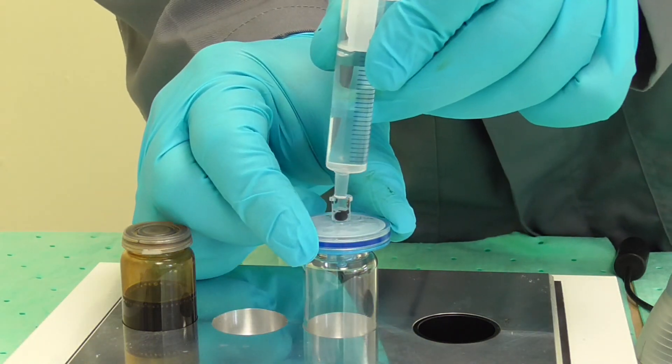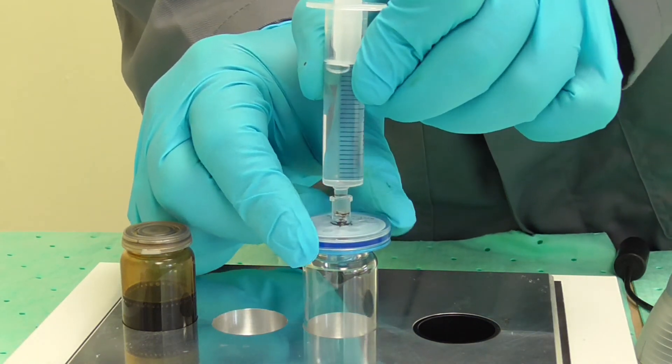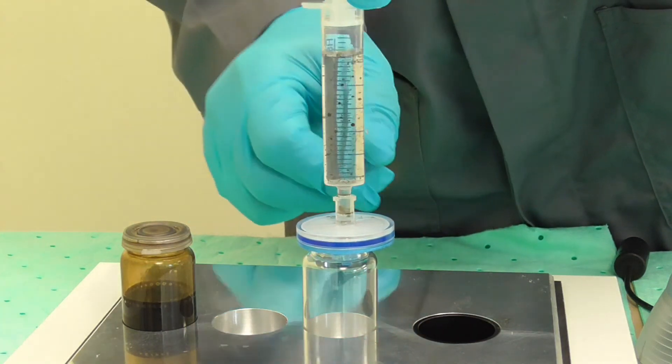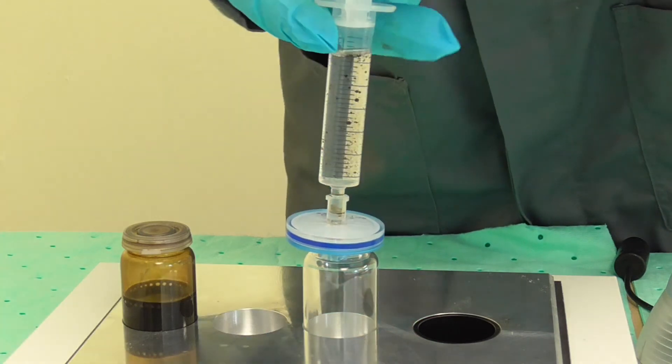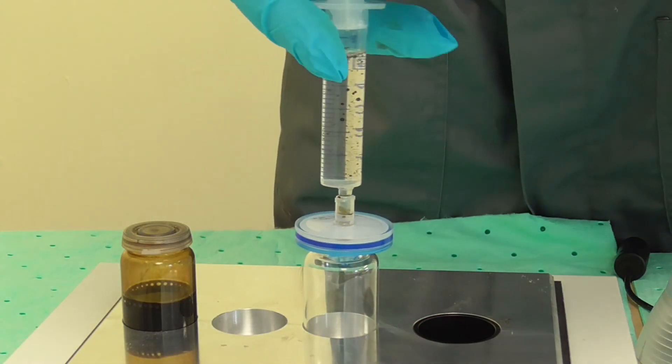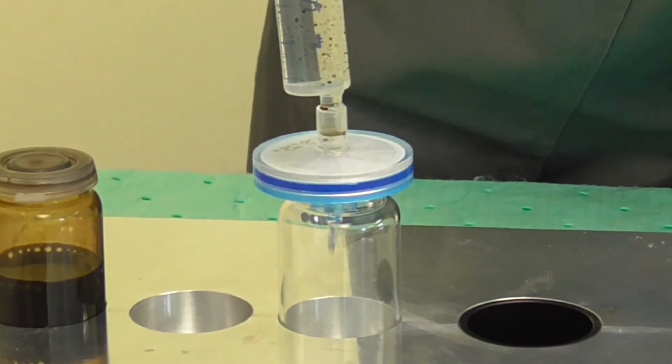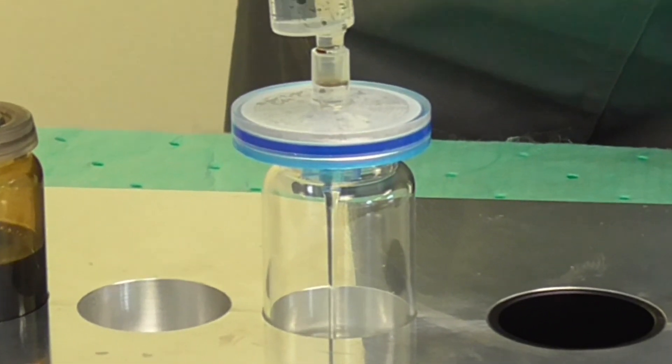Now firmly pull the syringe's piston to its topmost position. Make sure that the suction transports the fuel into the syringe's body. Now quickly but steadily increase the pressure on the plunger until you see a continuous jet. Do not use more force than needed for a continuous jet.